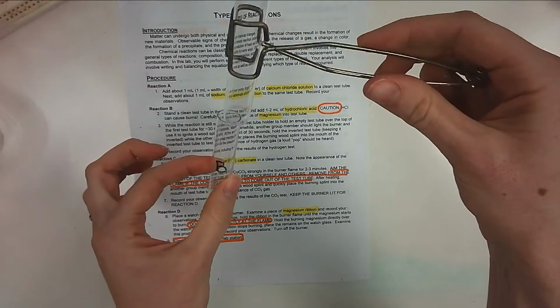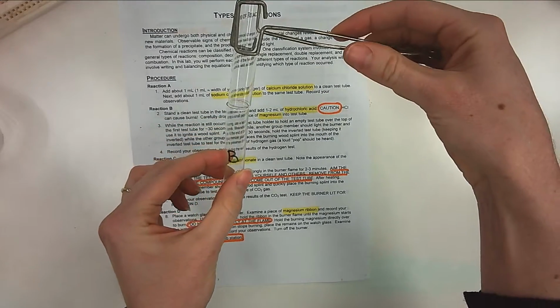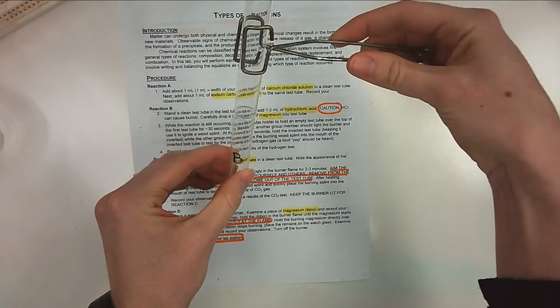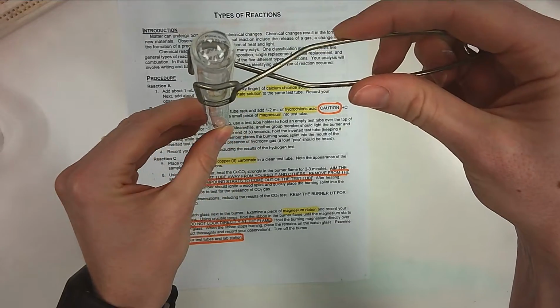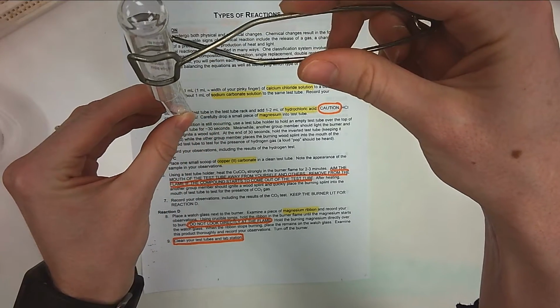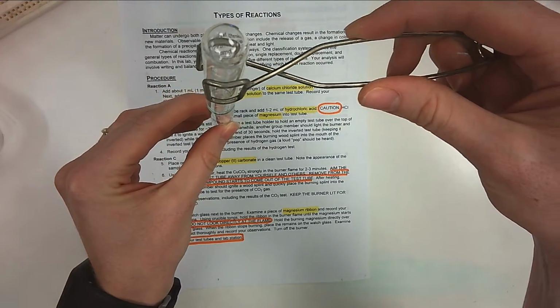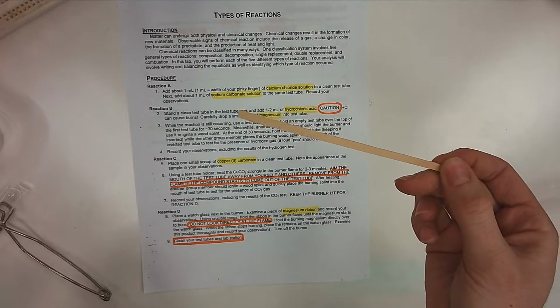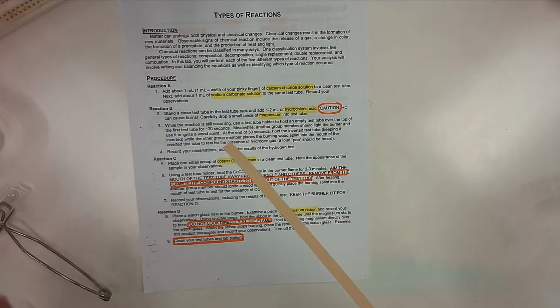So you can feel free to hold this one below, and you're going to hold a clean test tube over top. Now when you do this, these need to be vertical. All right, so don't have it tilted like I am. I'm just trying to show you what this would look like. So you're going to hold this right over top of the test tube for 30 seconds. So while one group member is doing this, another group member will take, this is a wood splint. You're going to place this into your Bunsen burner flame, light it on fire.